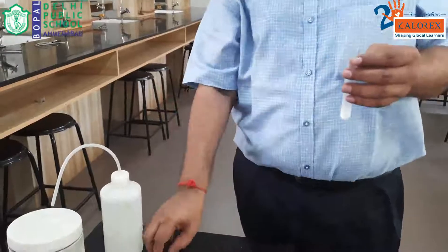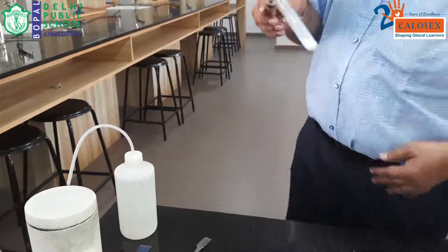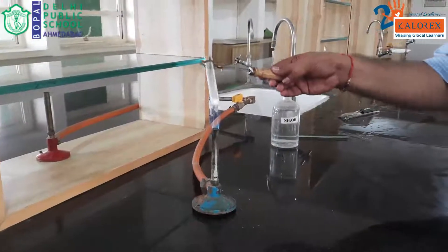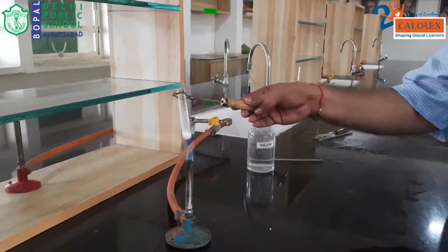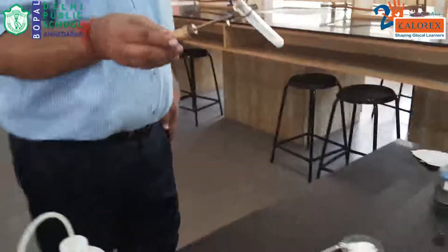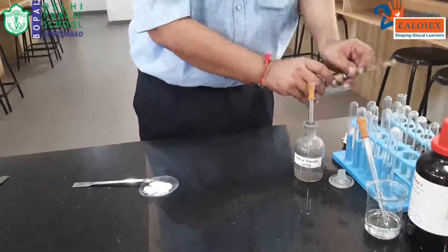Because barium is present and we added sulfuric acid, any white precipitate seen may be of sulfate ion SO₄²⁻. We heat the test tube — no gas is coming out, no vapors. No observation from dilute sulfuric acid. So we can conclude that SO₃²⁻, NO₂⁻ and CO₃²⁻ ions are absent. Now we go to the concentrated sulfuric acid test, which is very important. It can give us information about Cl⁻, Br⁻, I⁻ and NO₃⁻ ions.